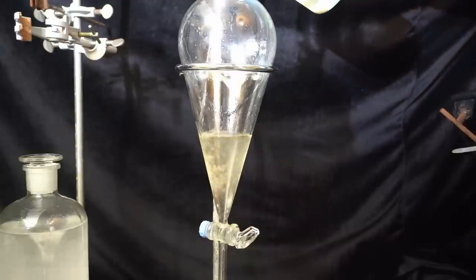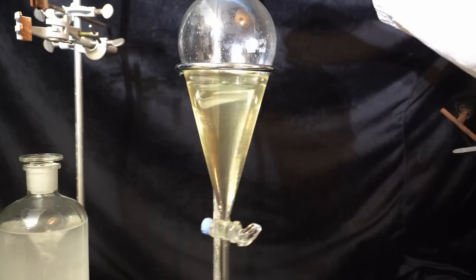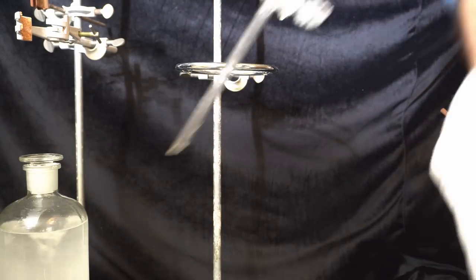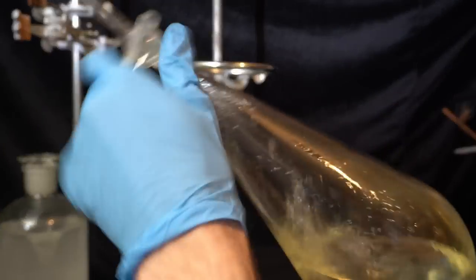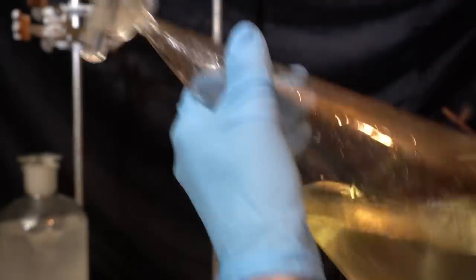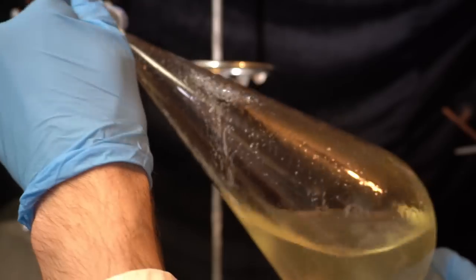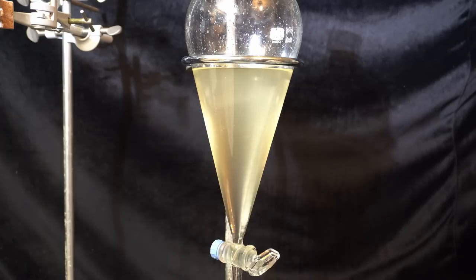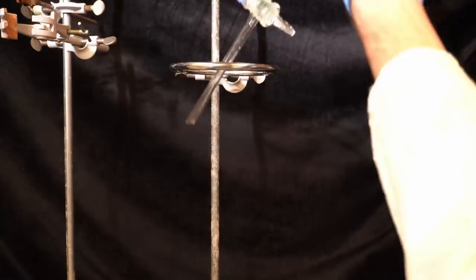The aqueous phase is poured back into the funnel and extracted three times with diethyl ether. Apparently, the water was still a little bit too warm, because when shaking and venting the funnel for the first extraction... Yep, that's all of the ether evaporating. Whoops. Anyways, I let the solution stand for a bit longer to cool down and then continue the extraction.